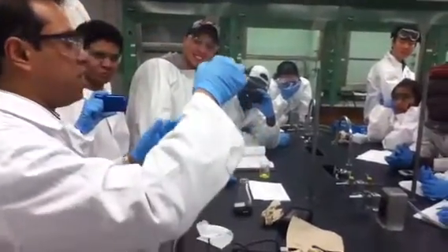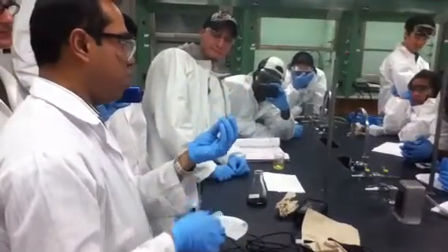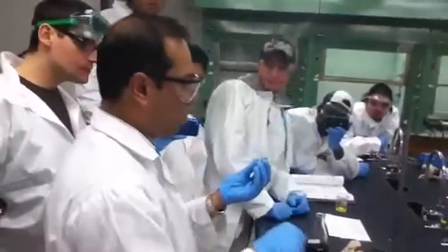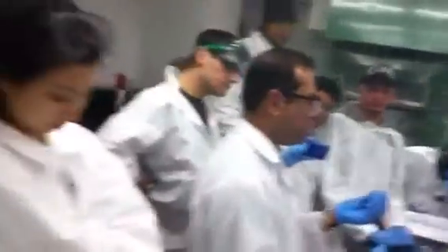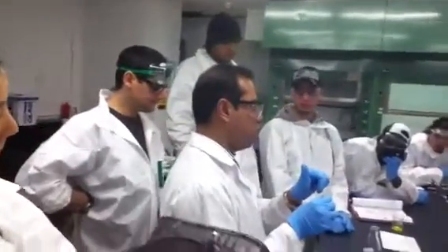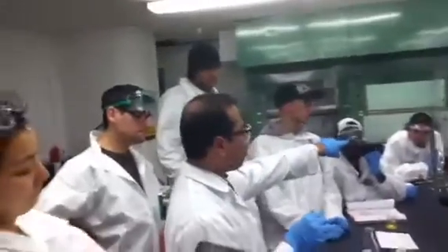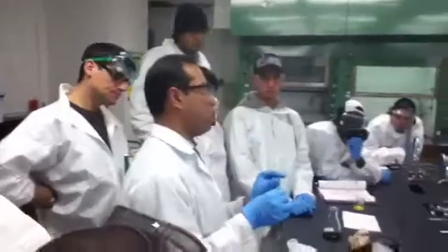The calibration in this case we have to do is first we tell the spectrometer that this is the spectrum of the water, for example, right? Now when it does the solution, it will subtract the water automatically because the software does it automatically. It will give us only the gold. If toluene is the solvent, we have to put the toluene in this case. So it will grab the spectra for the toluene, and then when it runs the spectrum of the solution, it will subtract the toluene and give us only the gold.